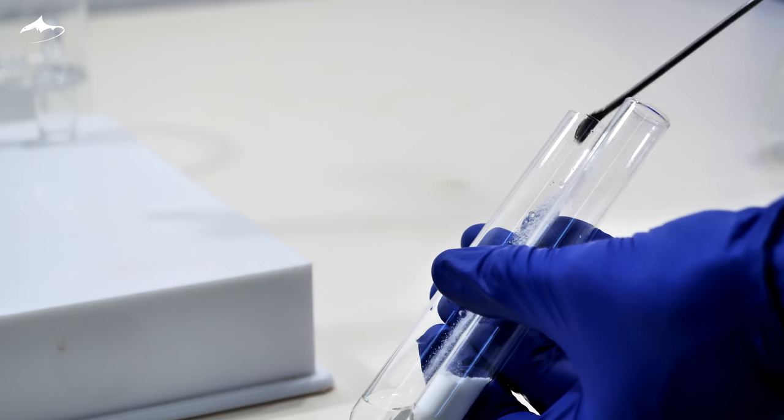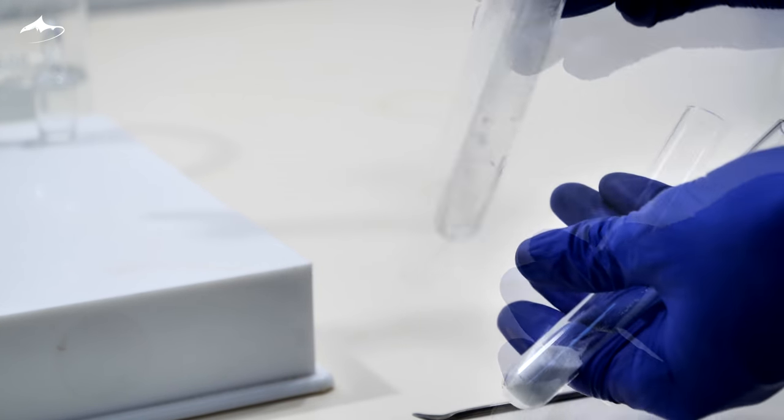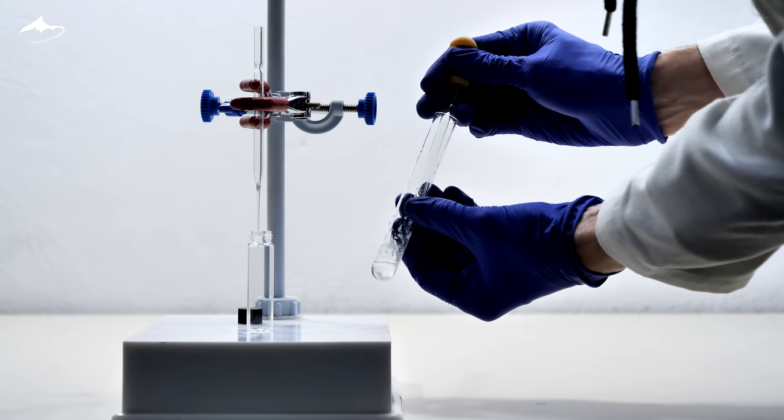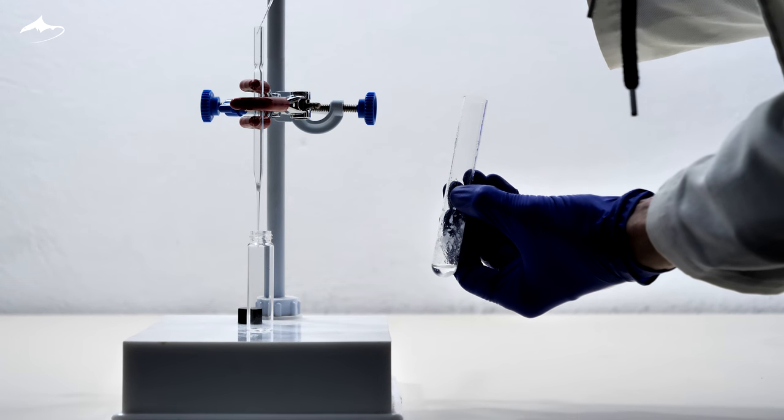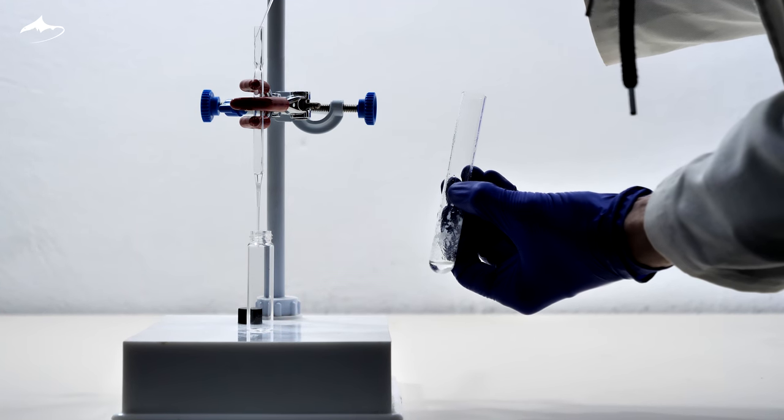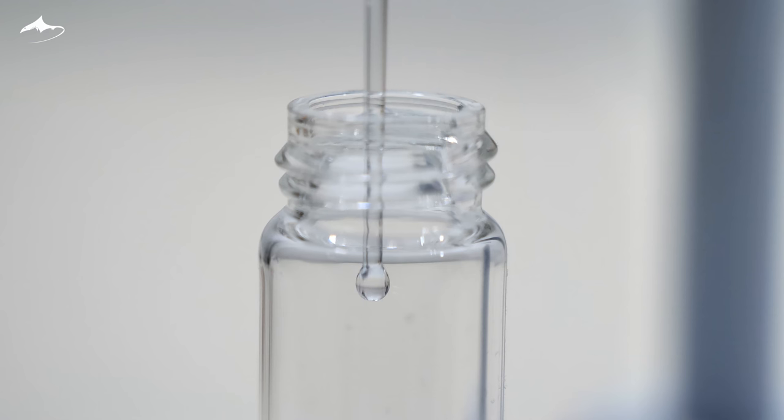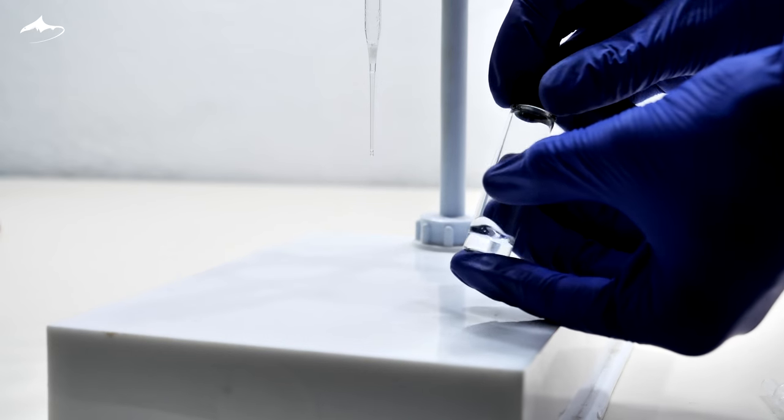A few spatulas of anhydrous sodium sulfate are added to try to dry it. After letting it sit for a few minutes, it is filtered using a Pasteur pipette with a cotton plug into a pre-weighed glass vial. I didn't mention it, but this side product smells quite good, reminiscent of tropical scent but a lot more concentrated. The vial is then capped and stored for weighing purposes.